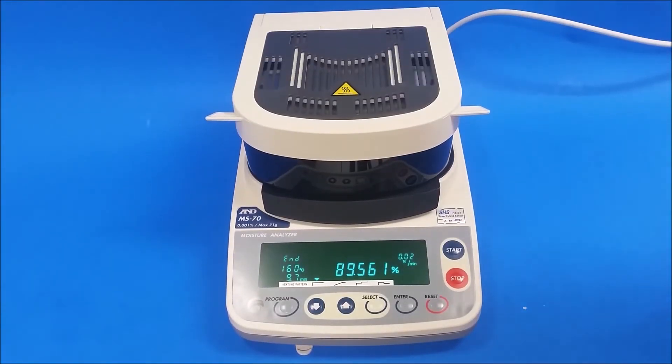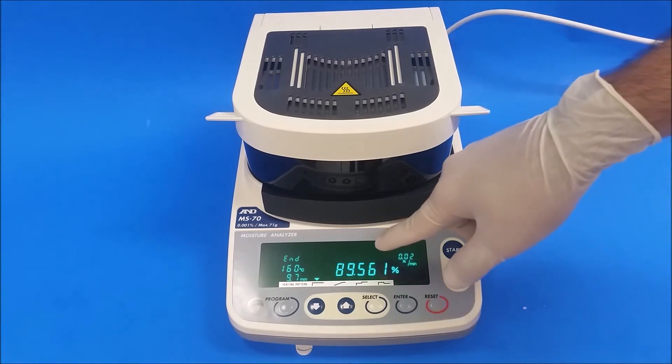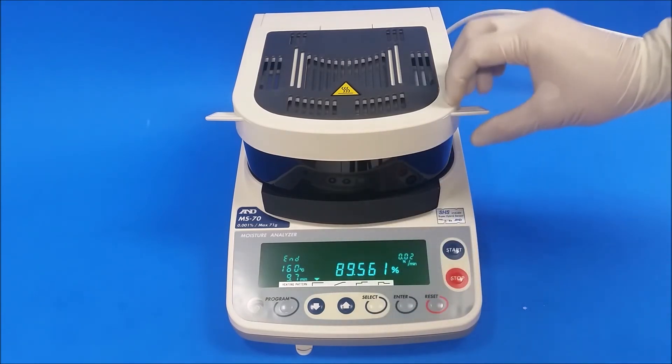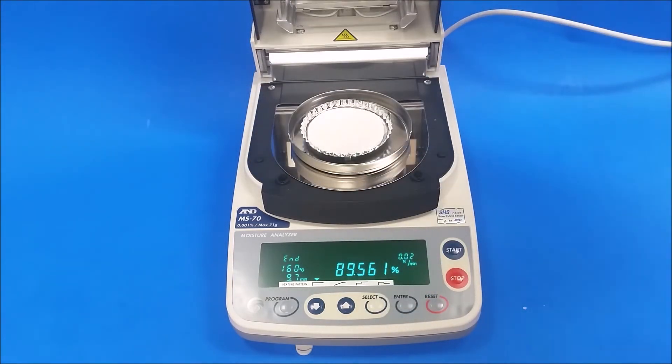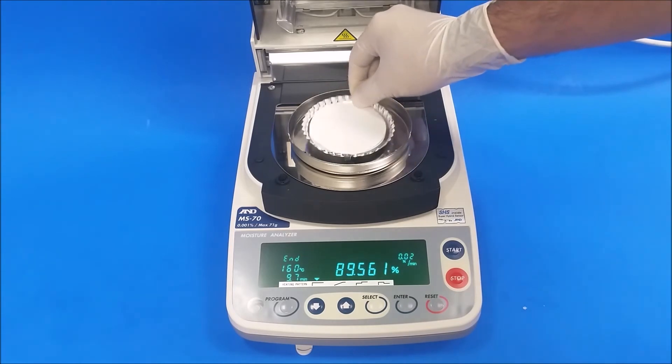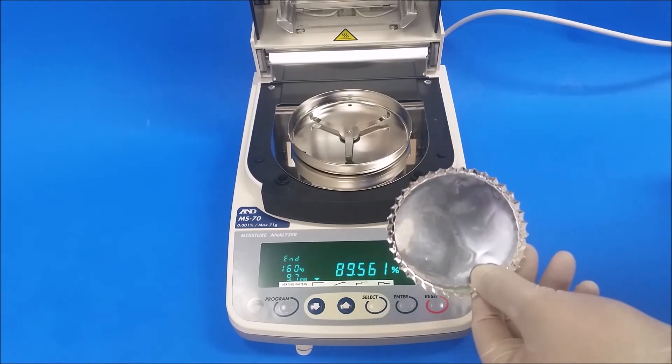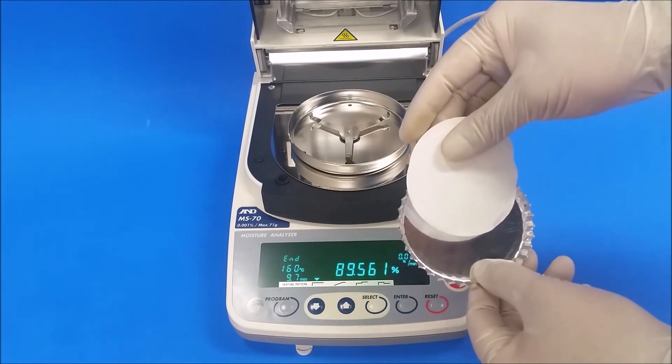Once it's finished, it's gonna give you a few beeping noises and then it's gonna give you your final results and the time how long it took. The next thing to do is dispose of this. You don't want to reuse this and be careful it's hot. If you're gonna run another test, get a new dish and two new pads.